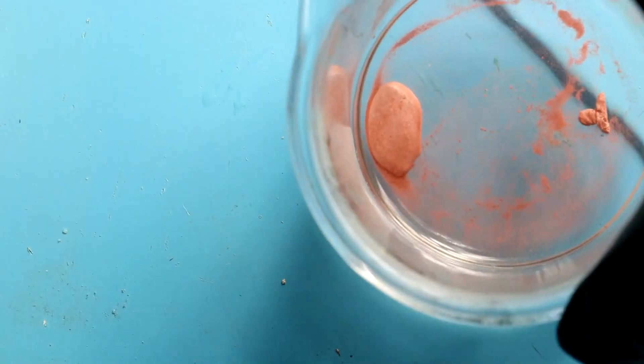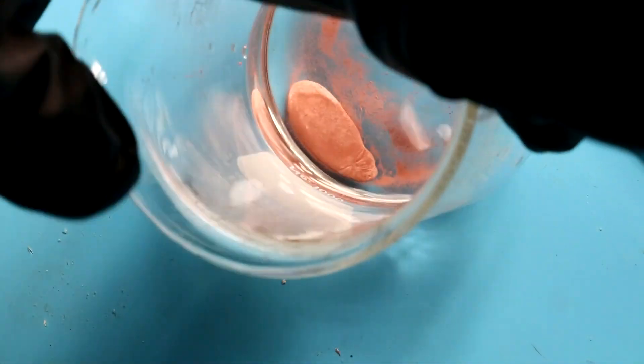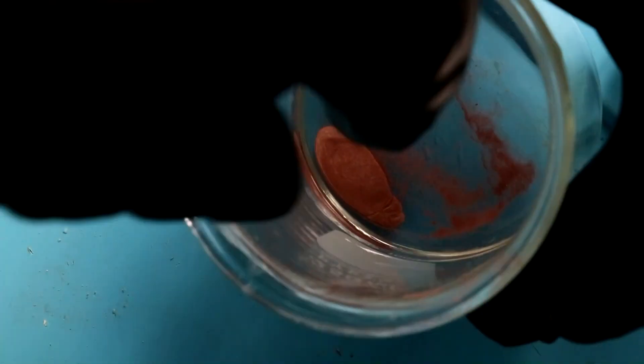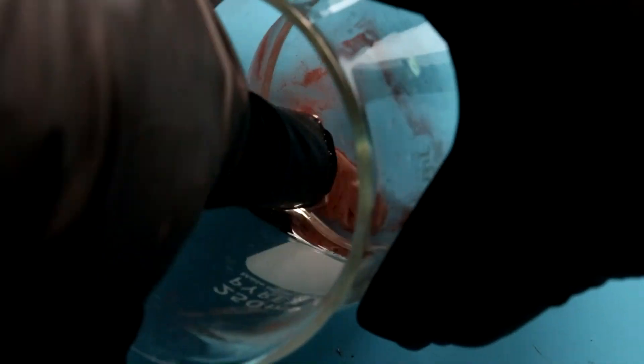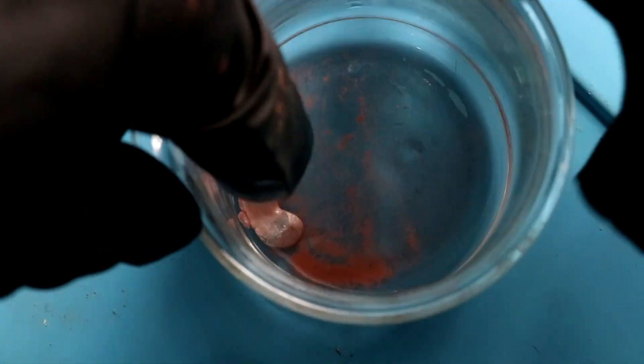Looks like I've got just a little bit too much mercury. Let's see maybe I can squish it around a little. Yeah you can definitely see it's a little bit hard and goopy. You know I might be able to squeeze out the excess mercury. Alright so I've got rid of most of the water.